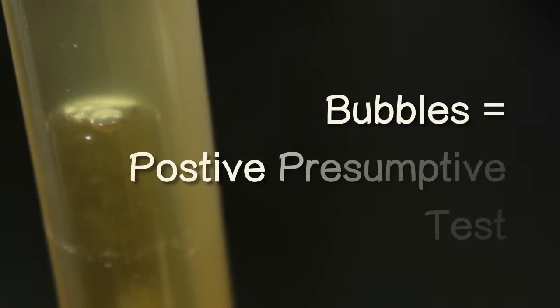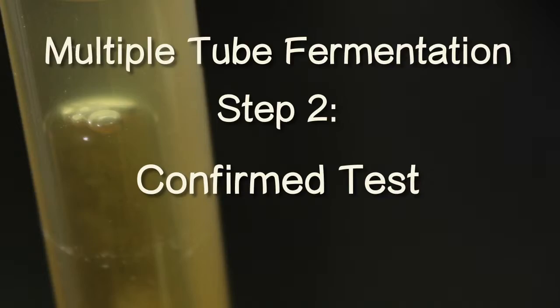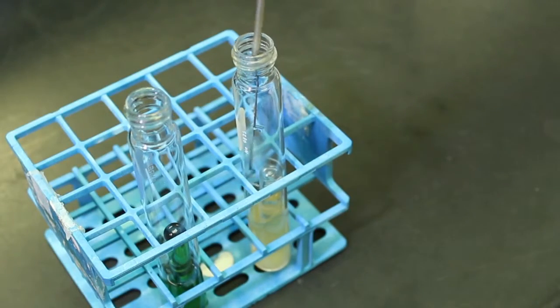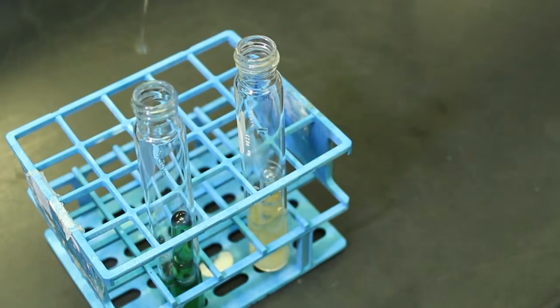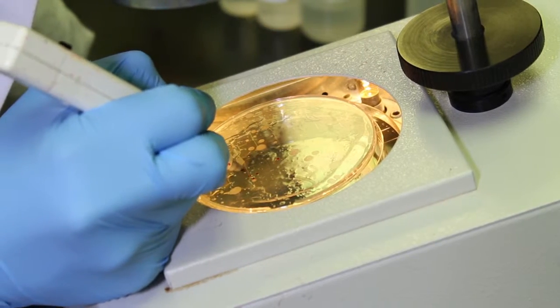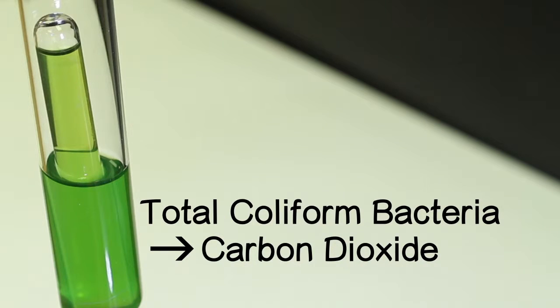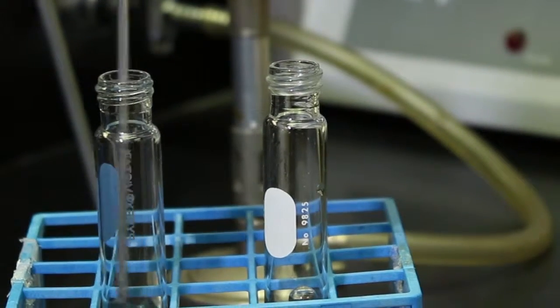If bubbles are evident, we have a positive presumptive test. In that case, we are required to move to the second step in the multiple tube fermentation analysis, the confirmed test. A sample from each positive presumptive test tube is then transferred into a new test tube containing more sugar and another ingredient, brilliant green bile. While several microorganisms may show up as positive under the conditions of the presumptive test, only the total coliform bacteria will be able to produce carbon dioxide in the presence of the bile. That means the confirmed test is more selective for coliforms than the presumptive test.